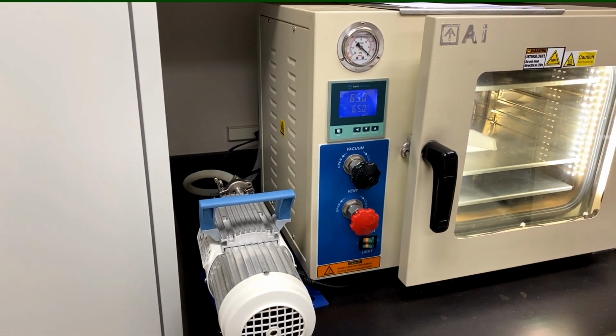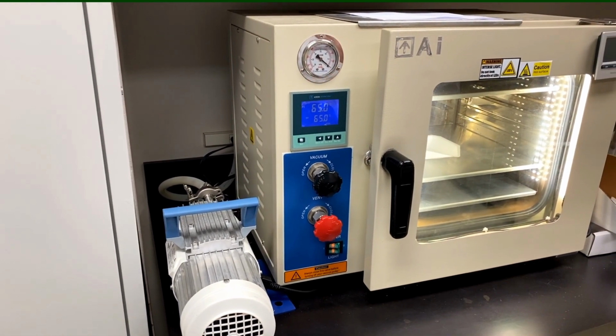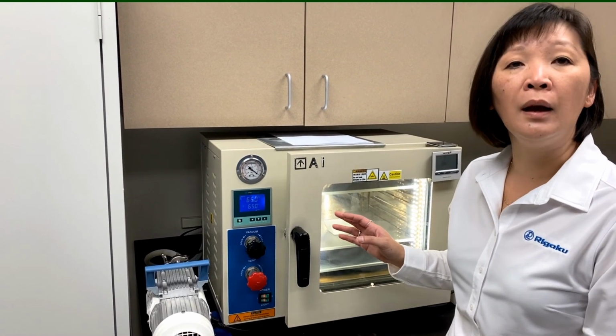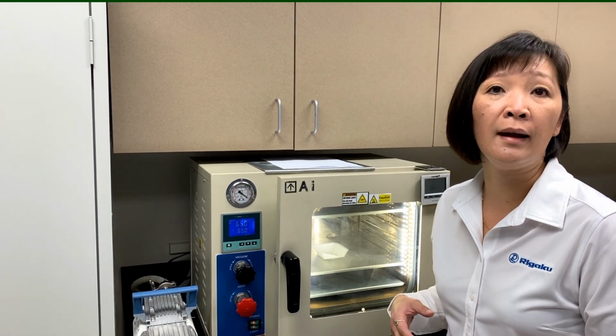Once it's dried, you can analyze it directly, again, straight in vacuum. You do not have to do this under helium. There's no film involved, and there's a very small amount of sample. So this is great for any kind of residual catalyst screening, where the supernatant is. If it's in there, you'll see if it's purged it out or not.